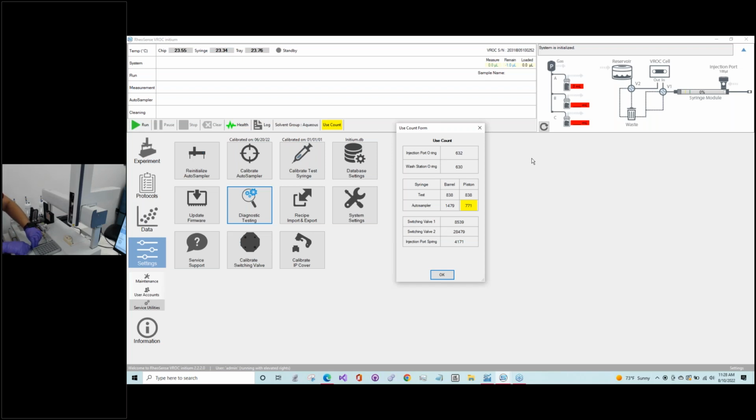All right. So we're going to have someone else come in and try to unscrew this very quickly, since I'm having a little difficulty getting it off. Guess I have to work out a little more. That's fine.